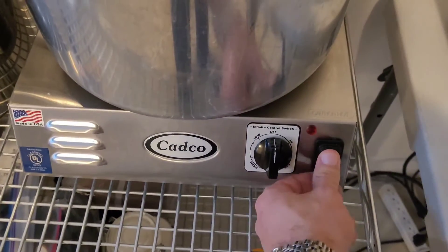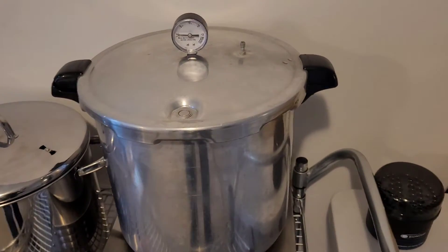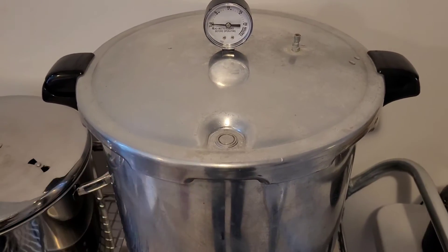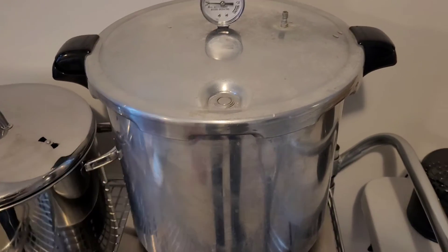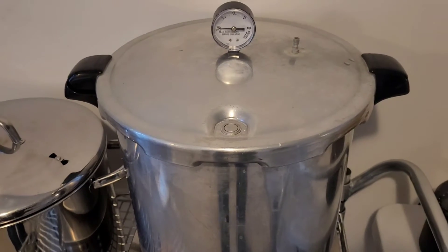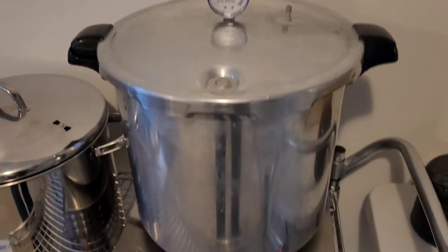Make sure your valve is open. Turn on your heat and let it heat up to the point where you can hear an audible hiss coming out. You're going to hear some sputtering. You need to purge the trapped gases for at least 10 minutes - I prefer to go 15 minutes. Less isn't more. The trapped gases need to be replaced completely with steam, otherwise you will not be reaching the desired internal temperature for sterilization.